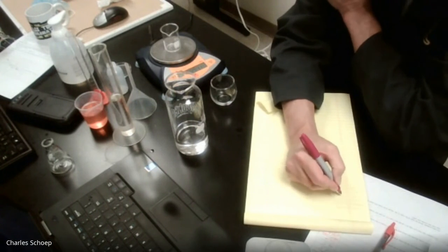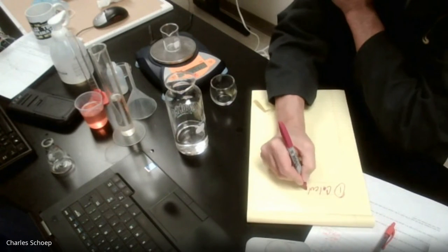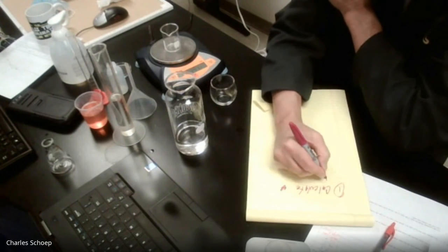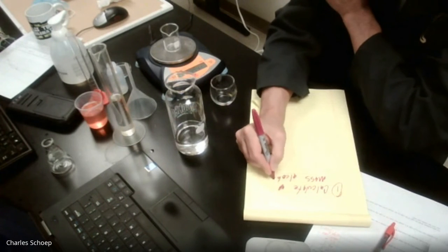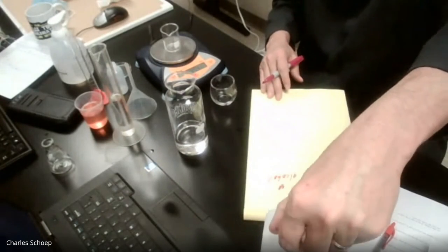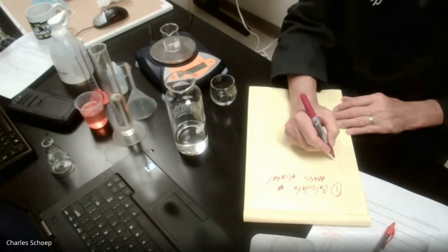So thing number 1, I want you to calculate the mass of the alcohol. Hey, I spelled that correctly.